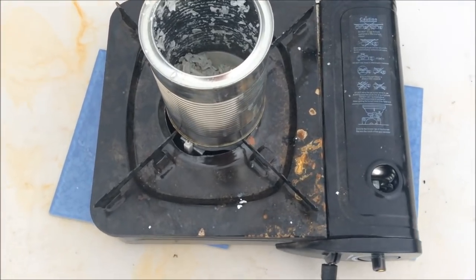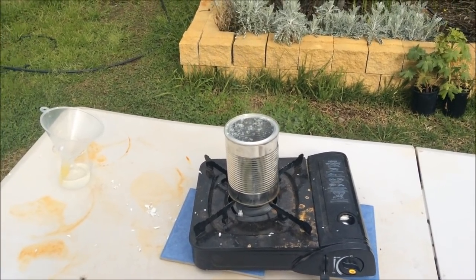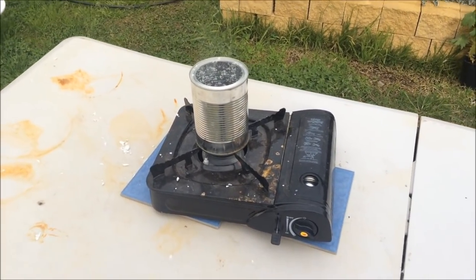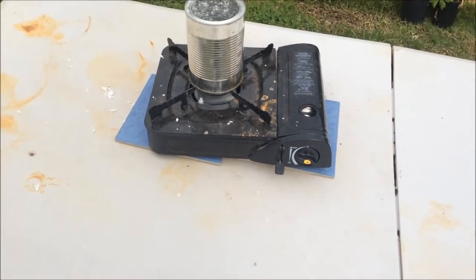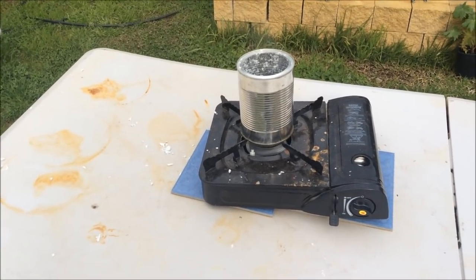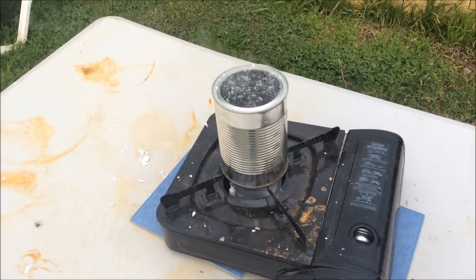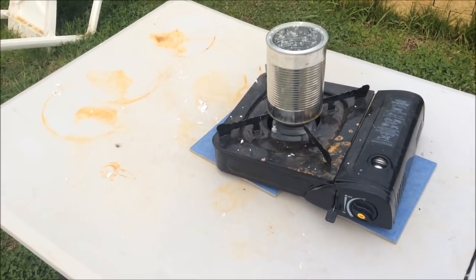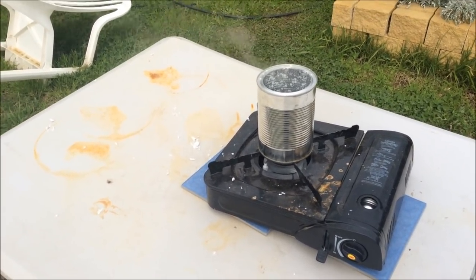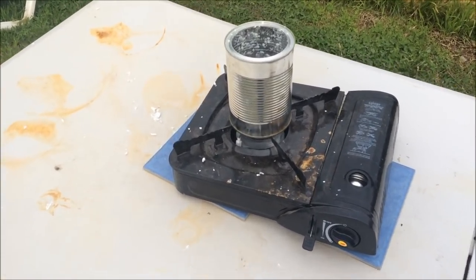Drying it like this is a terrible idea. It's just splattered everywhere, bumping uncontrollably. Yeah, it smells pretty awful, but not as bad as it did when it was refluxing without the condenser. So I assume most of the smell's gone with the ethylene glycol. It's sort of calming down now. Not really, but calm enough that it stopped raining hot sodium terephthalate around here, which is a nice change because it really wasn't that pleasant.